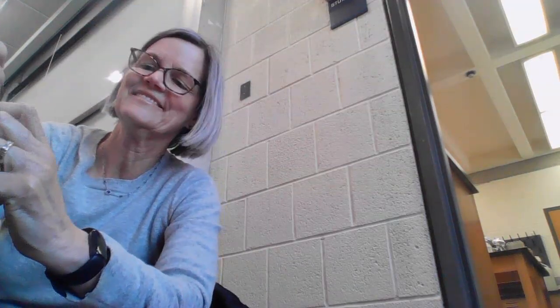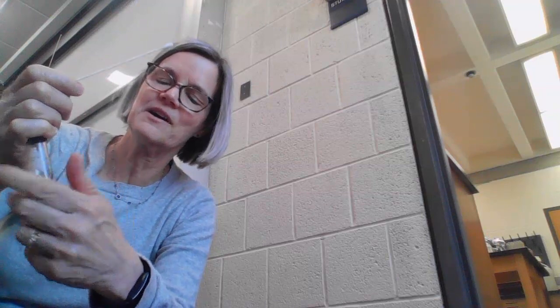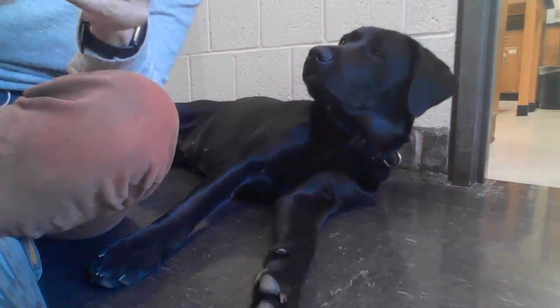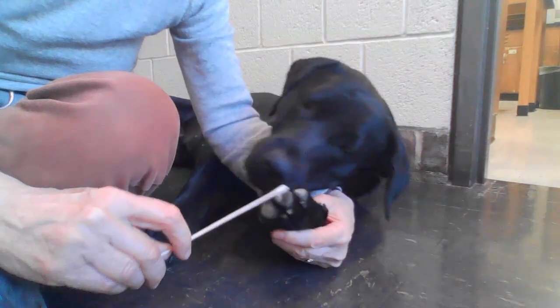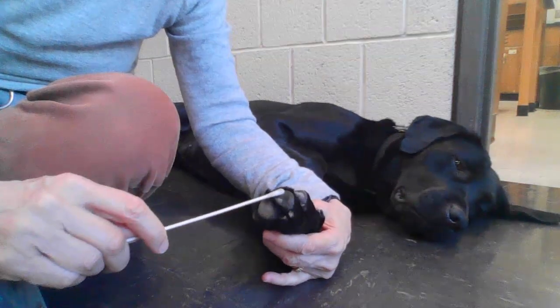Oh, here she just woke up. I'm going to get some water. I'm going to moisten it. And this is my dog, Jeanette. Jeanette, say hi. Say hi. And I'm going to take her paw, and we're just going to swab it. You like being an experimental dog? No nose prints. There we go.